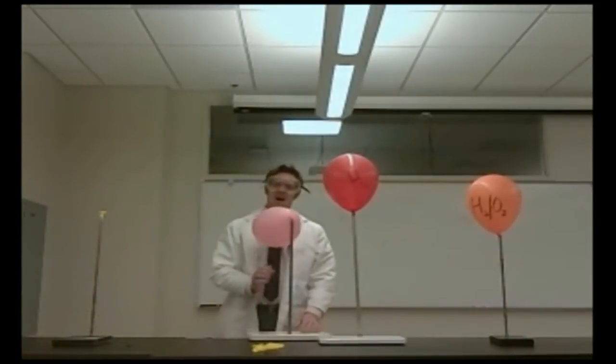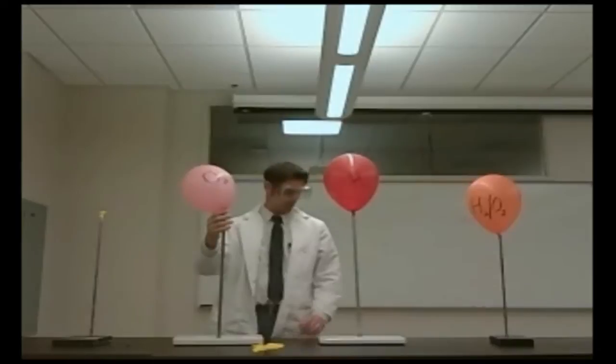So, as you can see, that was not very flammable. Let's see if this balloon, filled with pure oxygen, is flammable or explosive.